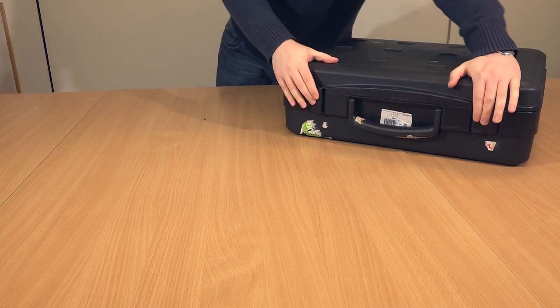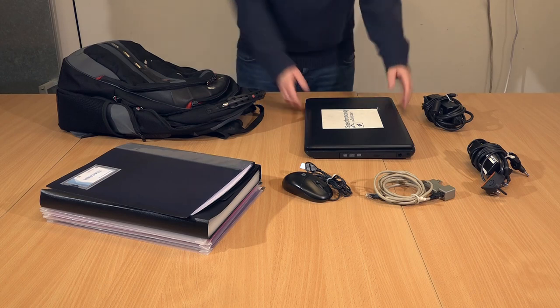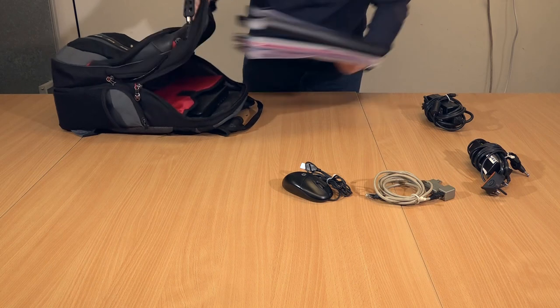Then pack away the laptop, teaching materials, power supplies, ethernet cable and adapter, and mouse into the rucksack.